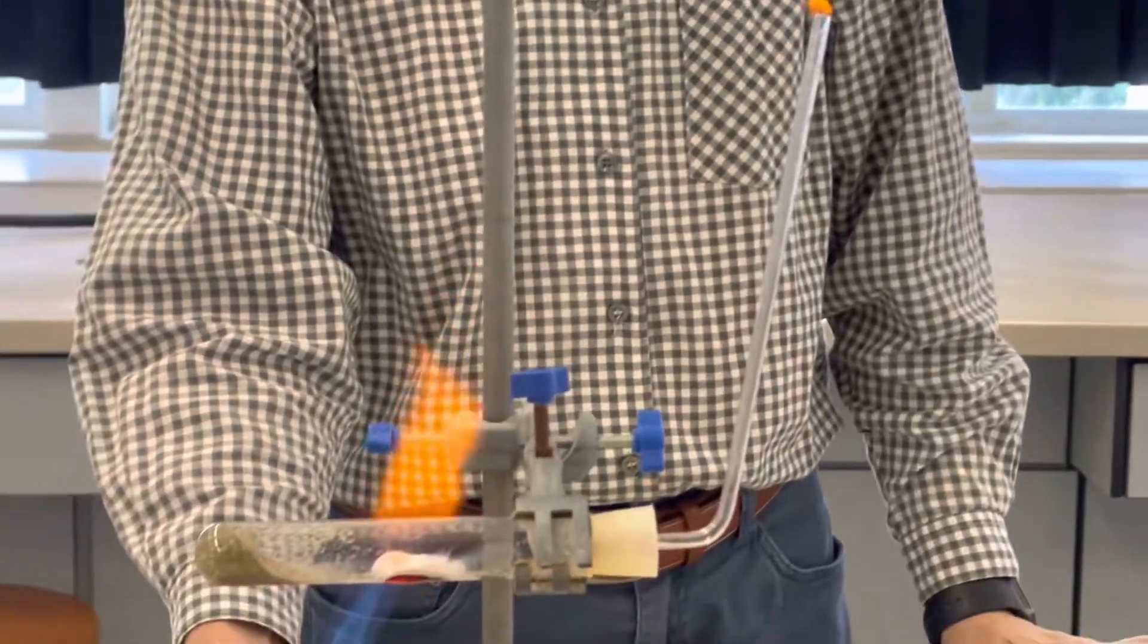Over there, at the top of this tube, there is a flame.